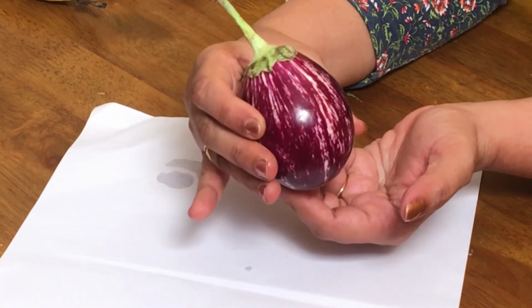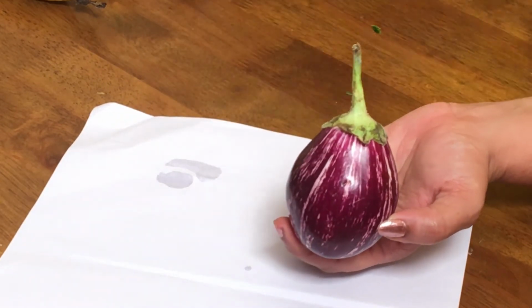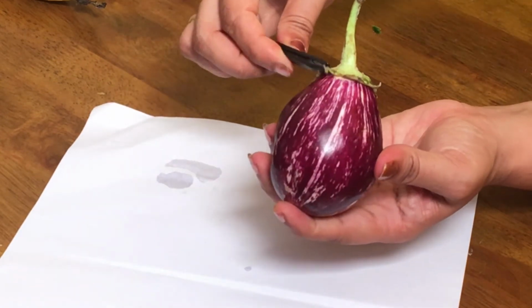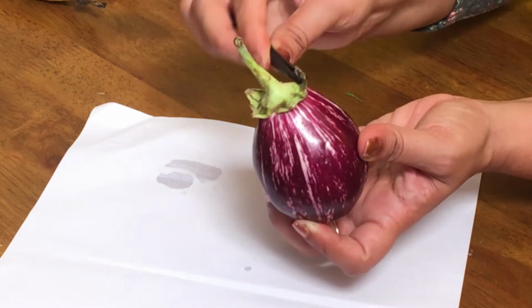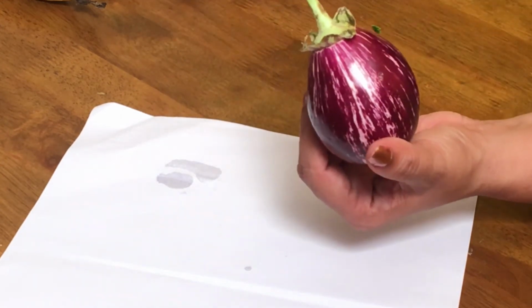This is again a fruit. This is the stalk of the flower. This is the persistent calyx. This is the calyx which is persistent, it will not fall off, whereas the petals had already fallen off. This is the persistent calyx, and this is a fruit that has ripened.